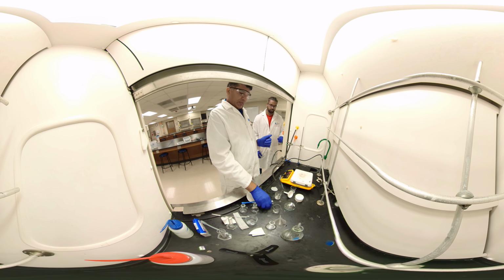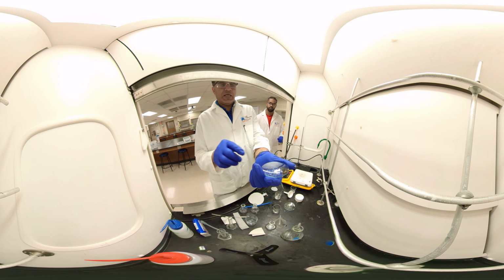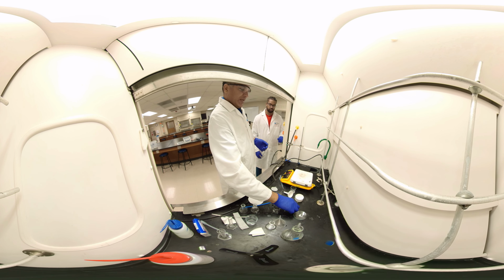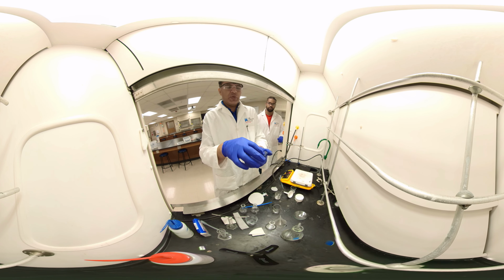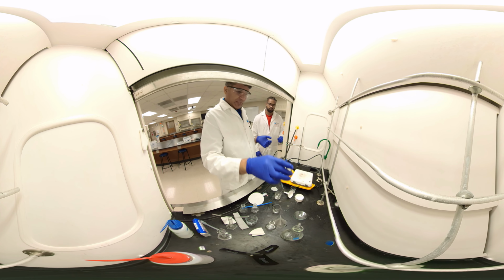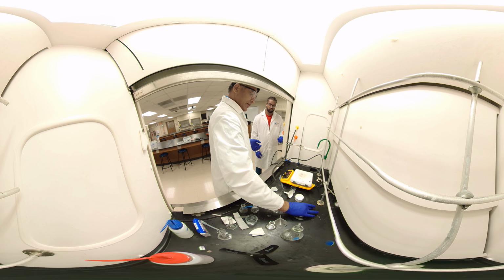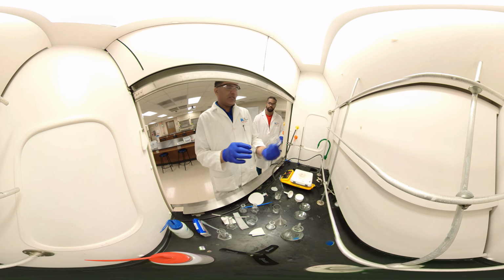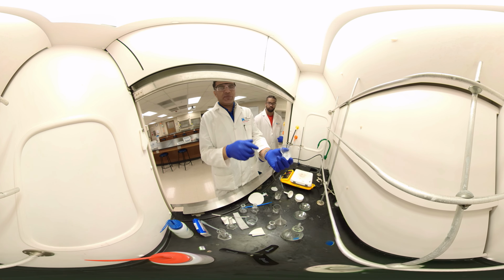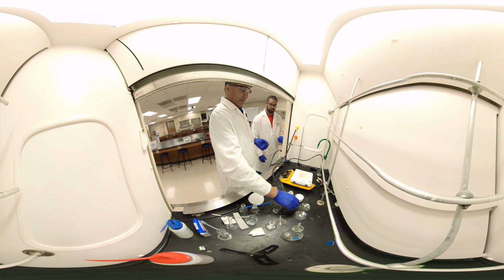All came out good. This is the binder, which is already dried. You can see the powder. We can collect the weight. Good. And we calculate the yield. Aspirin came out good. We still have to collect the melting point and analyze, but it's good. Caffeine is really good, nice crystals in a needle shape. It has some residue, we'll scrape it up. We are expecting very low, like 30-40 milligrams, which is good.